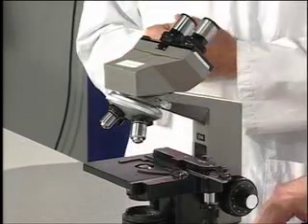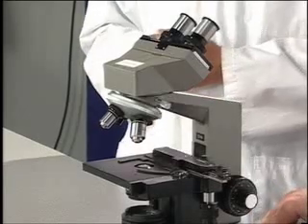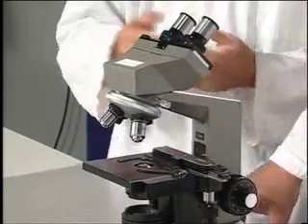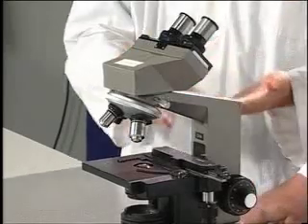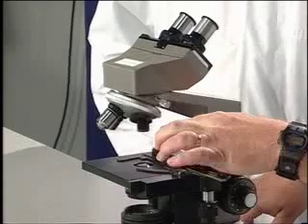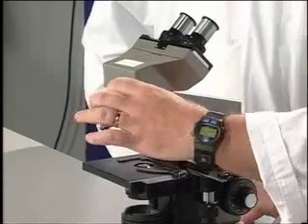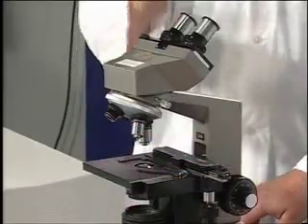their normal power. But this one doesn't have anything on it. Does it have one? This one there is a blank one, and that would be for an oil immersion lens, and that would have the capabilities to multiply magnification up to 1,000 times. Perfect for bacteria. So I've got the regular one there is what, 4? 4. And then? 10. And then? And then 40.